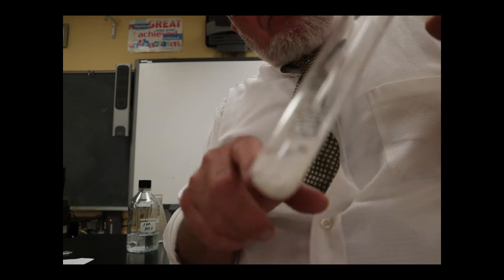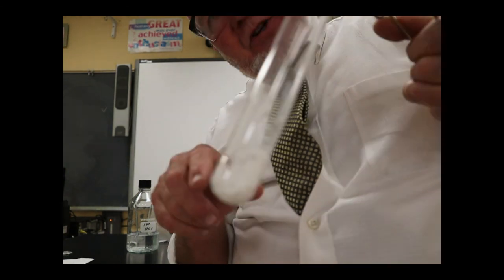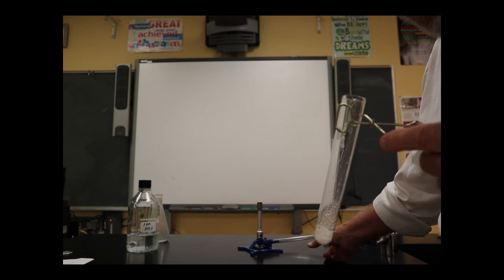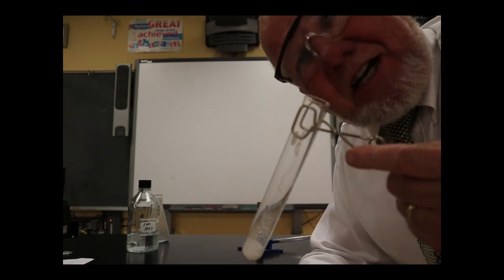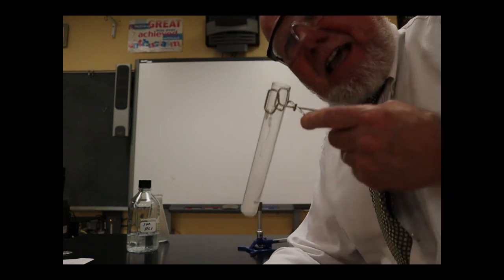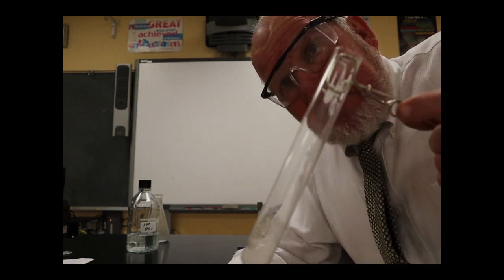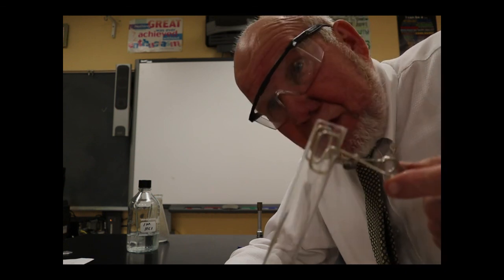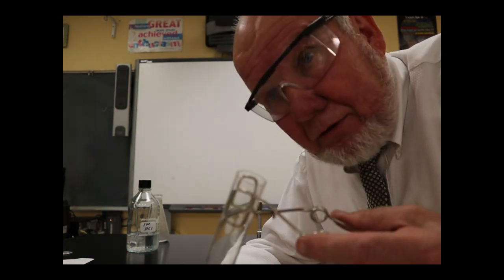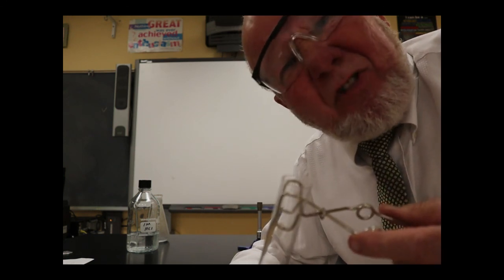We can do the stoichiometry calculation to calculate how much I should have got from the 0.25 grams. But you can see that based on what's on the table there, the stuff that's spilled out, I'm going to have a lot less. So my percent yield is going to be really low in this case. I've got to consider how I'm going to do this experiment a little differently next time so that I can get a better percent yield. Because your percent yield is your actual yield divided by your theoretical yield times 100. I bet I'm probably at 30%.